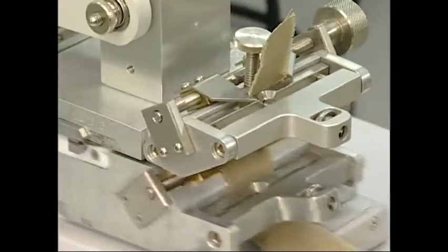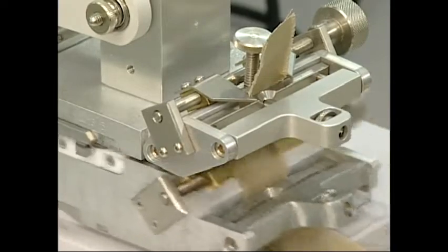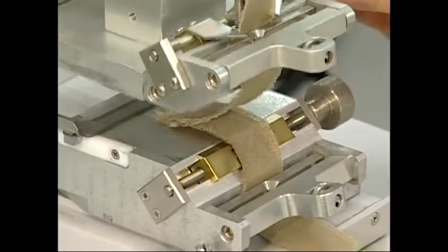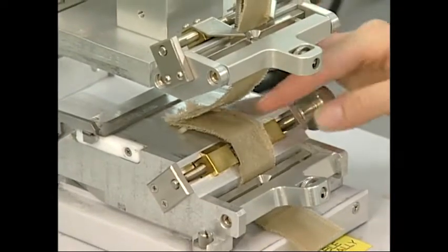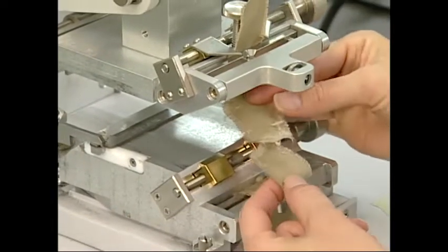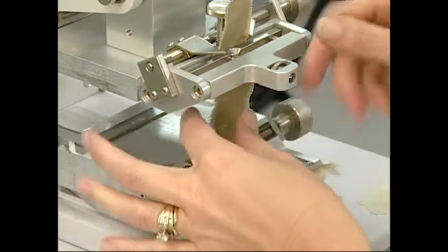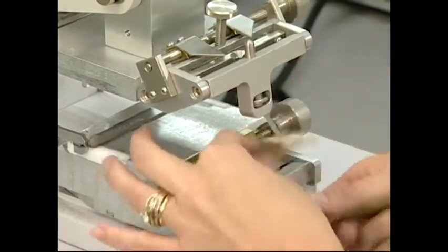In some applications of flex abrasion, the color change and the appearance change in the fabric surface may be agreed upon by parties involved and become part of the criteria for the specimen passing or failing. In these cases, the knowledge and abilities of the operator are critically important.